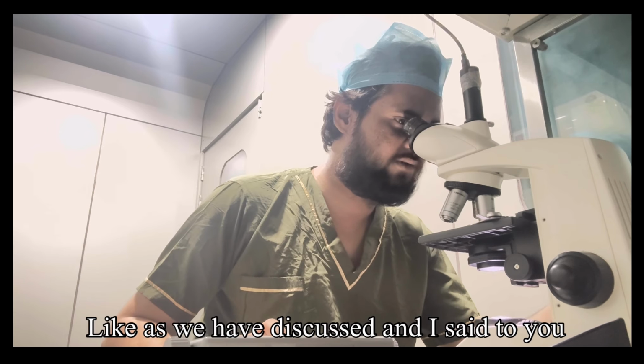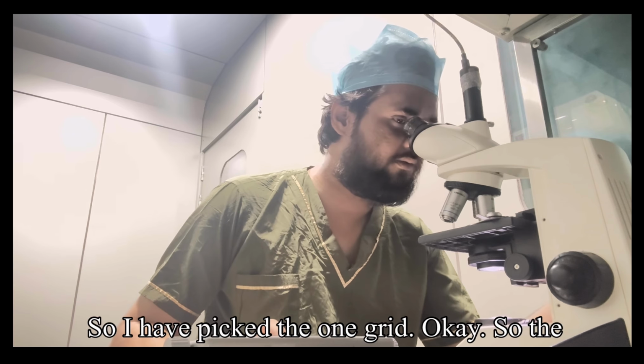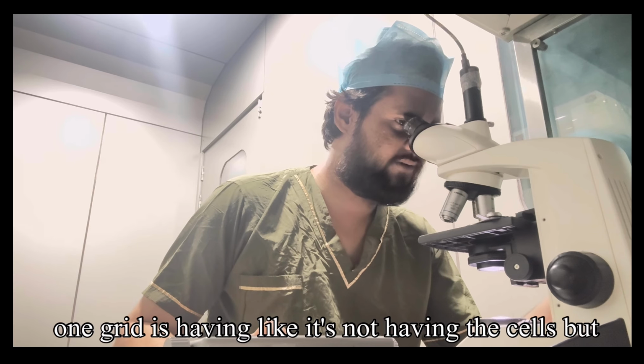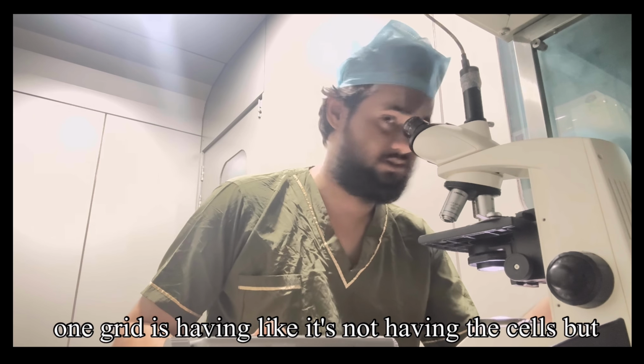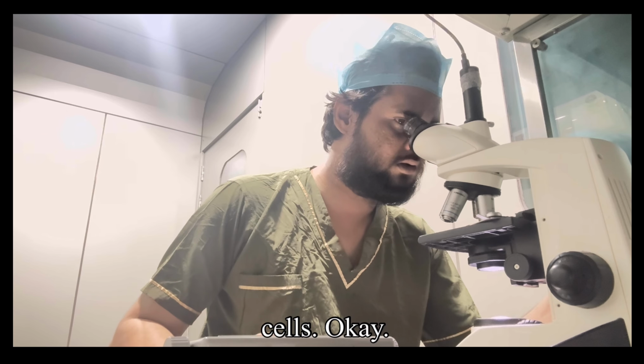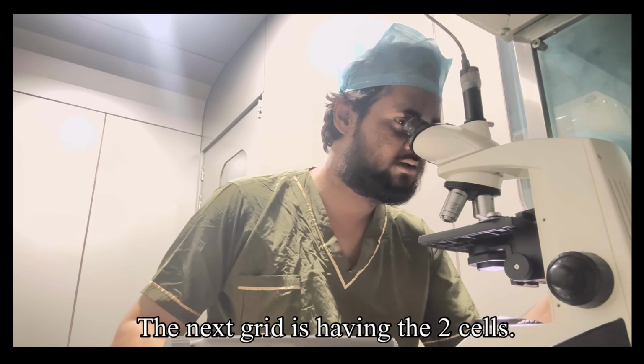As we have discussed, we will keep counting the grids. So I have picked one grid. Let's consider it has 3 cells. The next grid has 2 cells.